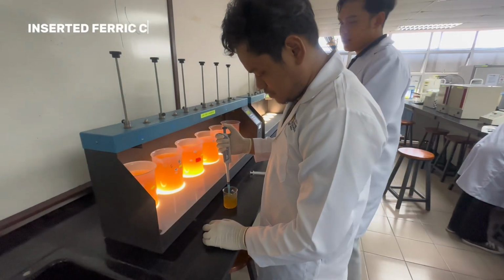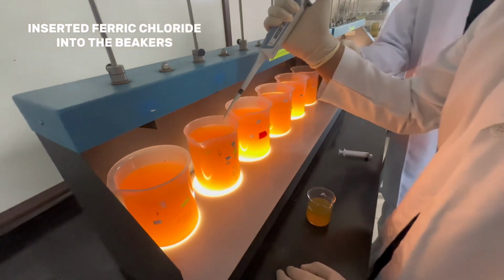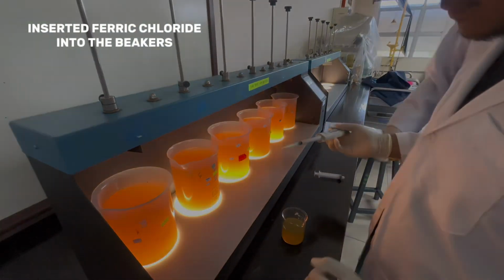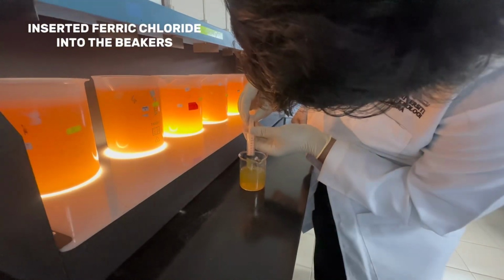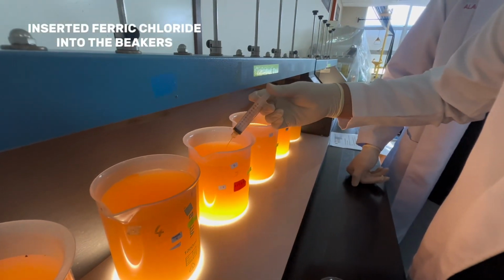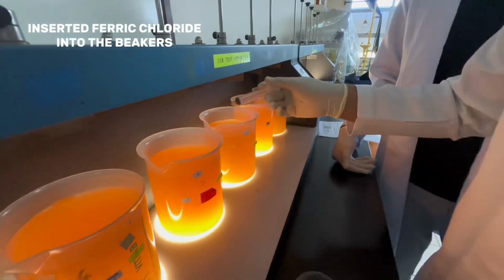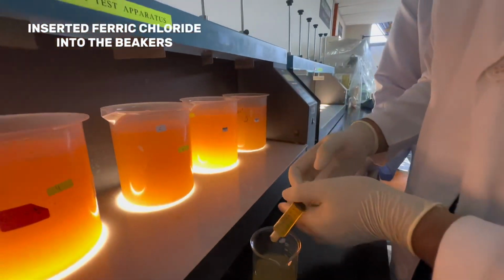Fourth, ferric chloride is prepared and 2 ml of it is inserted into the beaker filled with 1 liter of raw water sample using a micropipette. Fifth, 4 ml of ferric chloride is inserted into the next beaker using a 10 ml syringe. And this process is repeated until 10 ml of ferric chloride concentration is reached for each subsequent beaker.